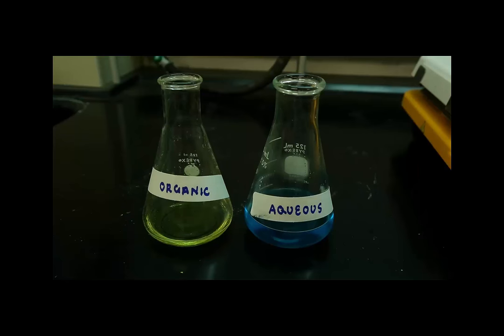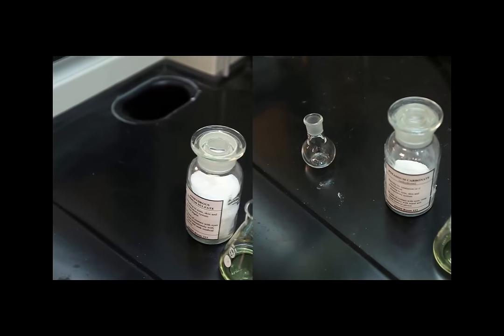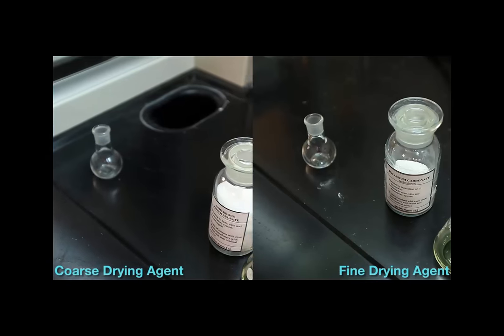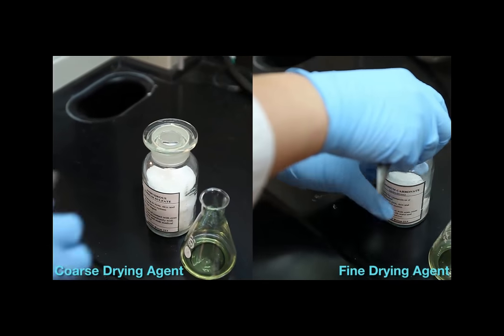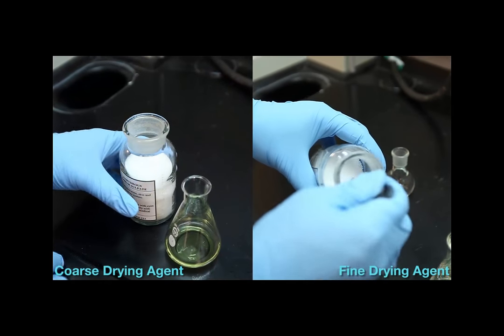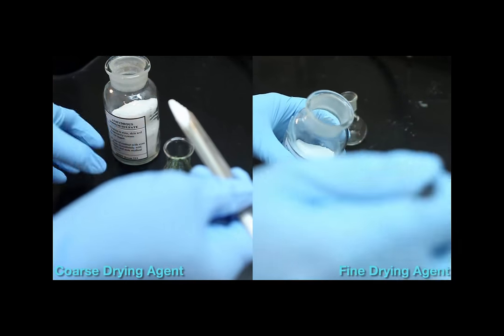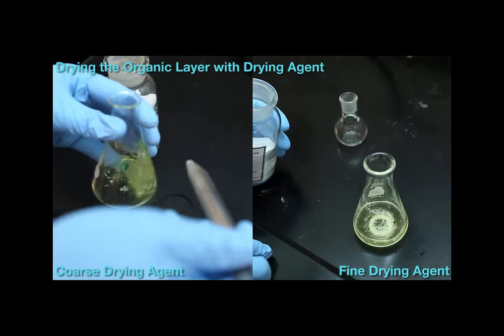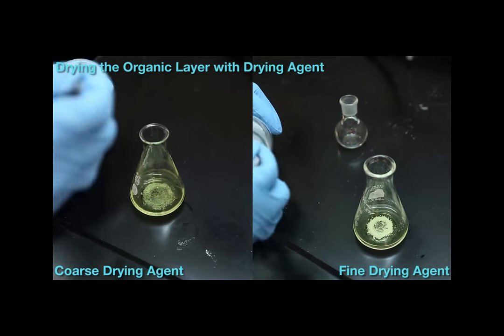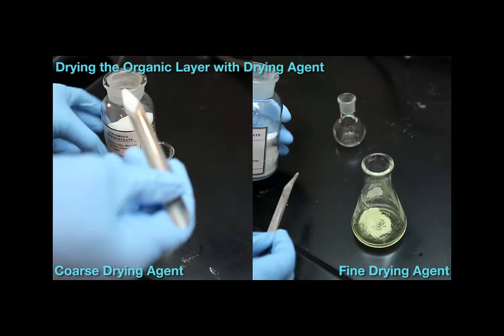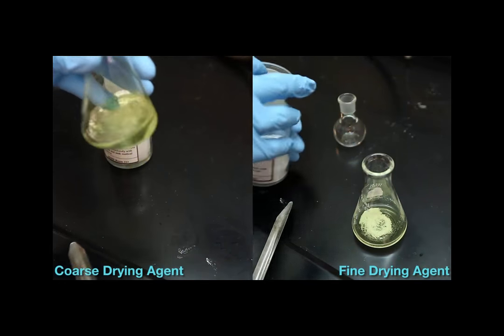Now we can proceed to the refined drying stages. There are several drying agents that can be used. Consult the blue section of your lab manual for the appropriate drying agents regarding your desired compound. Drying agents can absorb water from air, and therefore as soon as you've collected the drying agent you need from the bottle, it's essential that you cap the bottle immediately to minimize the amount of water that's absorbed by the drying agent.